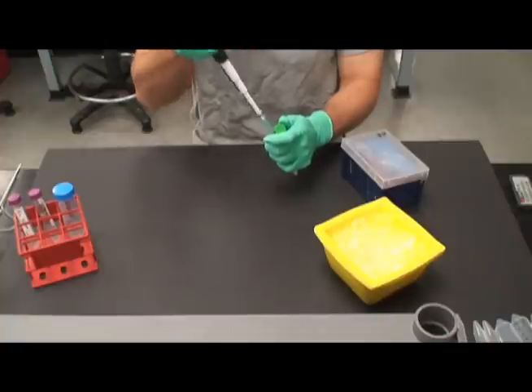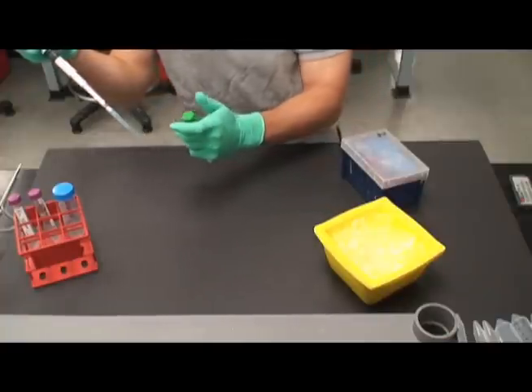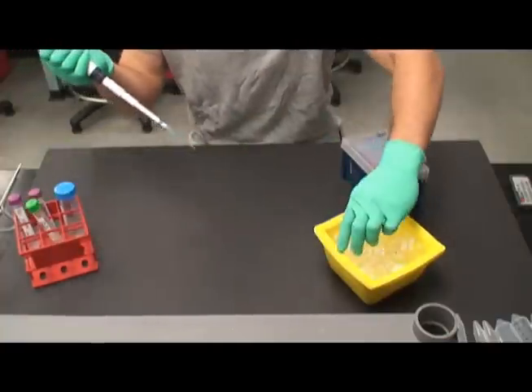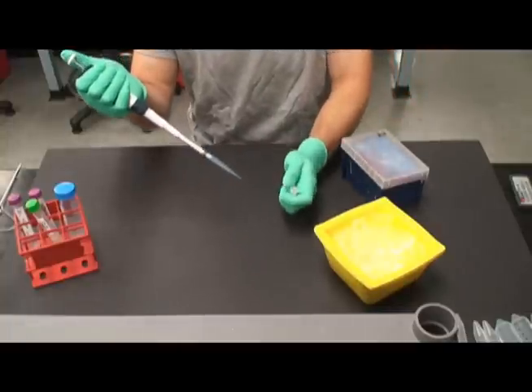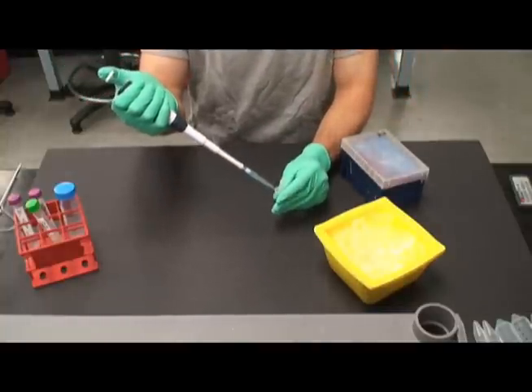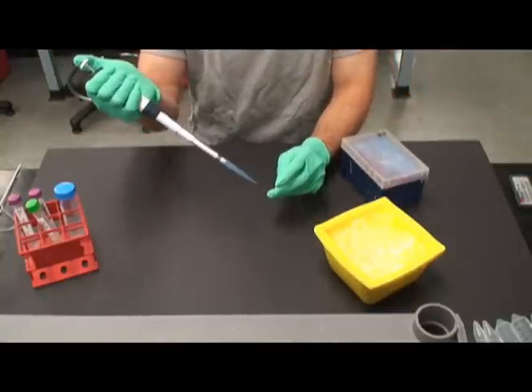Remember to practice sterile technique to prevent contamination. A sterile micropipette tip should be used for each transfer and the covers to various tubes should only be opened when necessary.